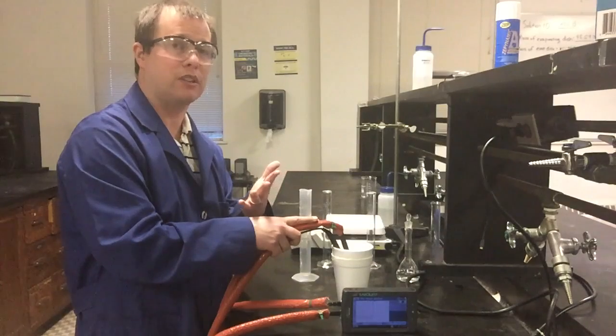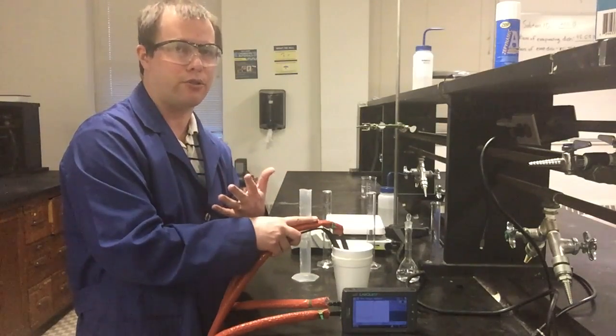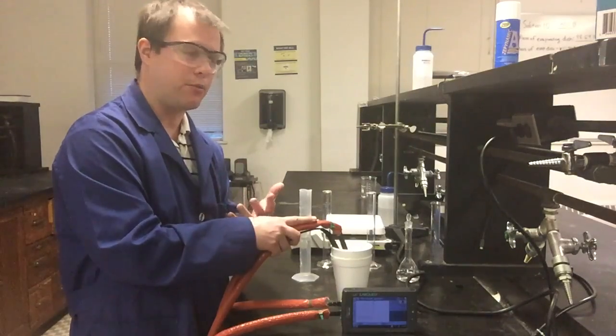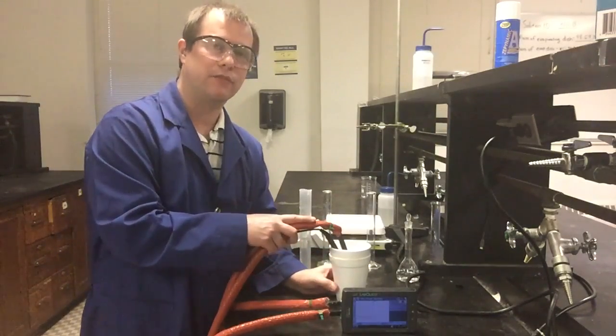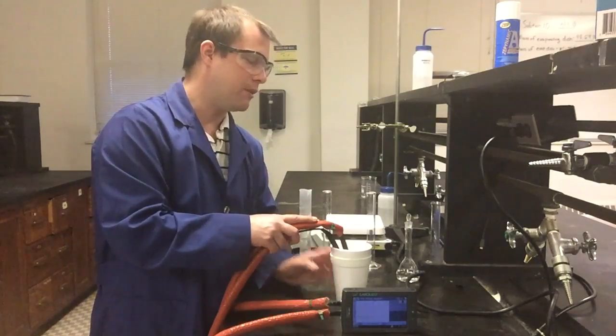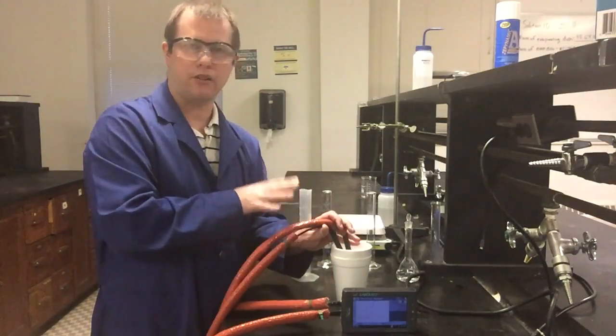That means the reaction's releasing it. So this is a very exothermic reaction, right? The energy in this reaction is being given off by the reaction. So it is going to be a negative delta H that you hopefully eventually find when we get to the end of our calculations.